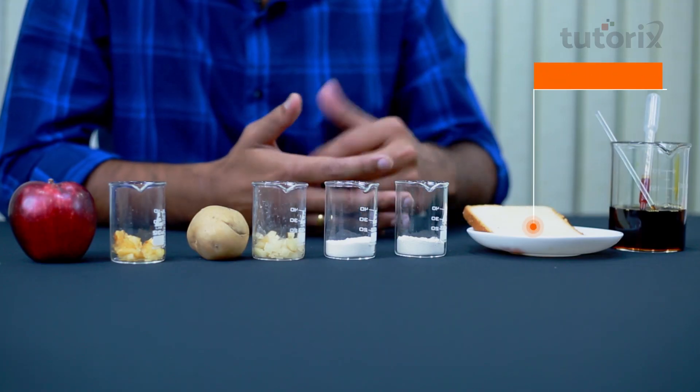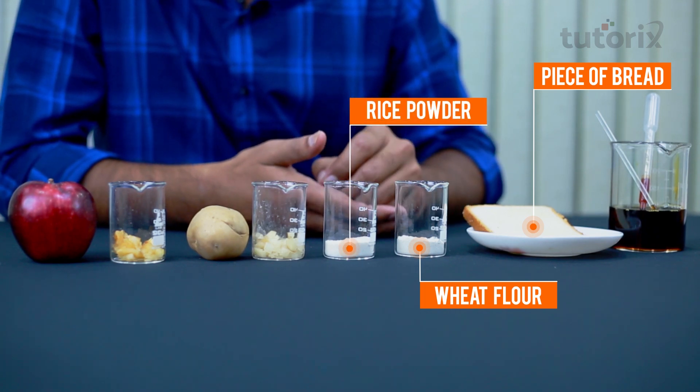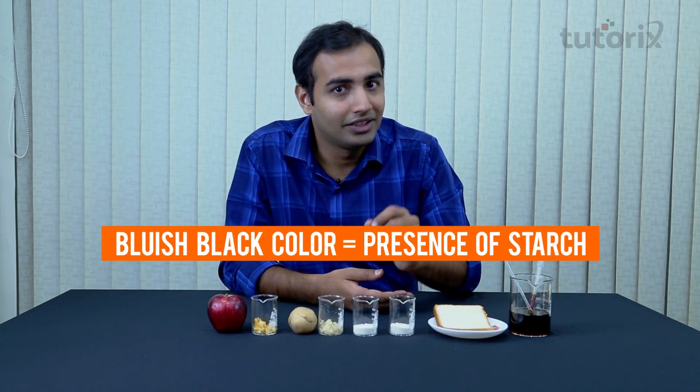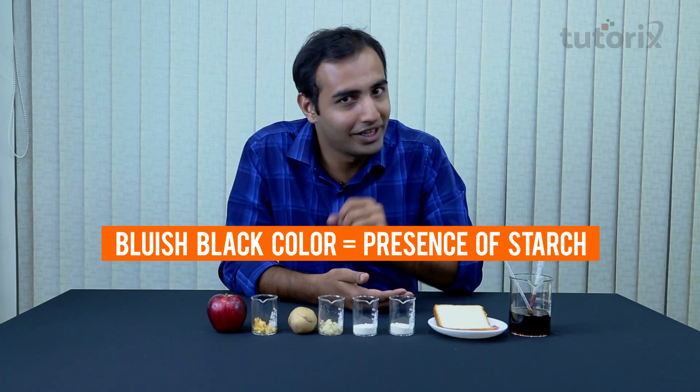Here we have collected some food items to do the iodine test on. The first one is a piece of bread, the second is some wheat flour, the third is some rice powder, the fourth is some minced potato, and the fifth is some minced apple. The intact potato and apple are kept so there's no confusion. Here is our iodine solution, and we'll be taking a dropper and pouring some iodine onto each of these food items. Wherever we get the blue-black color, that is a positive indication of the presence of starch.